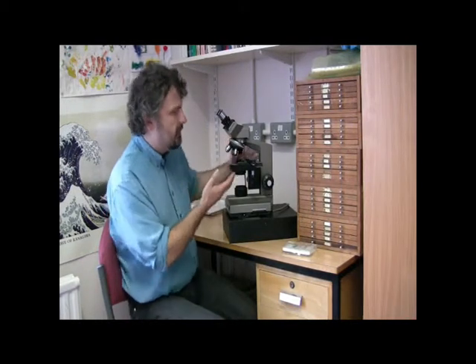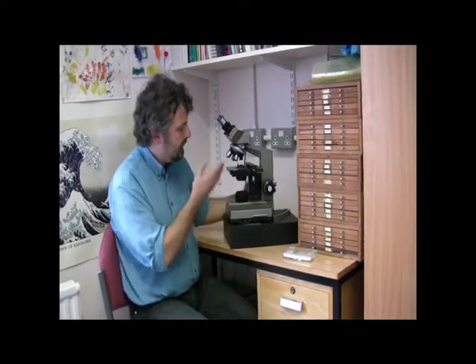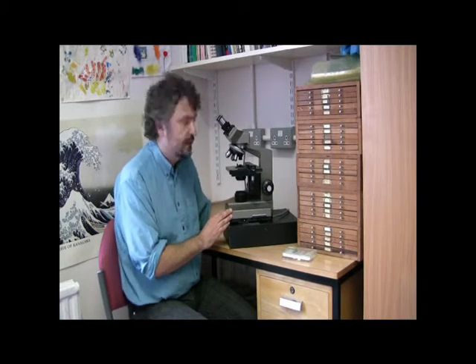But for routine counting of faunas and assemblages for paleo-oceanographic and paleo-climatic studies, then we would use a transmitted light microscope. For those who aren't familiar with the transmitted light microscope, I'll just run through the various parts of it so you know what I'm talking about.